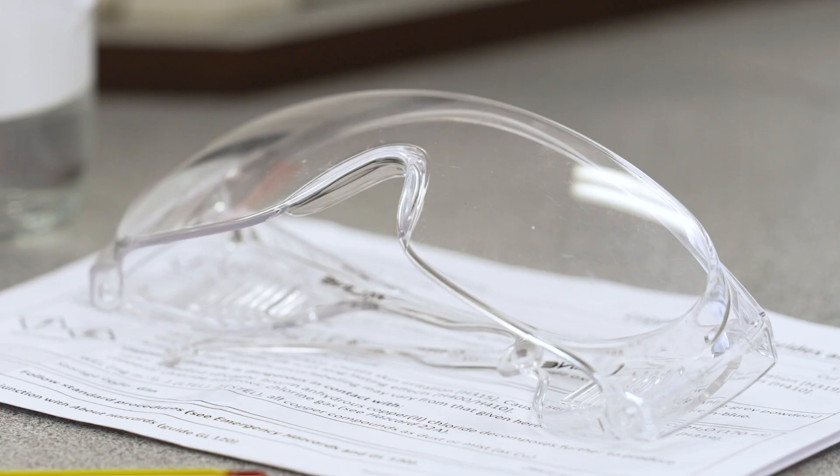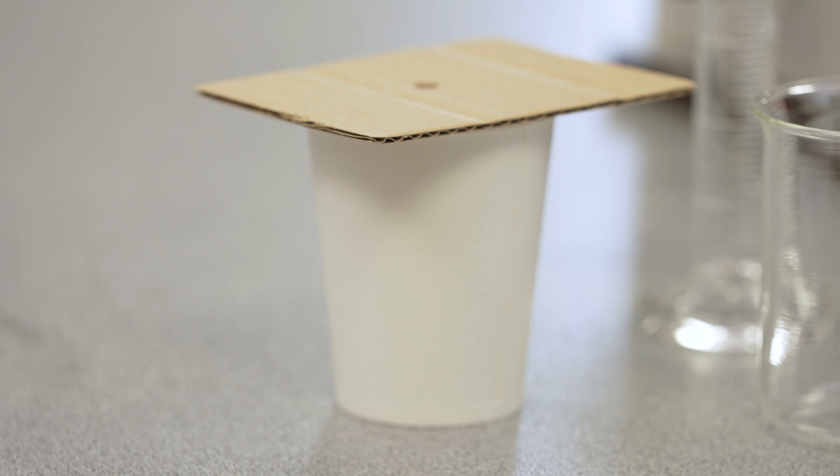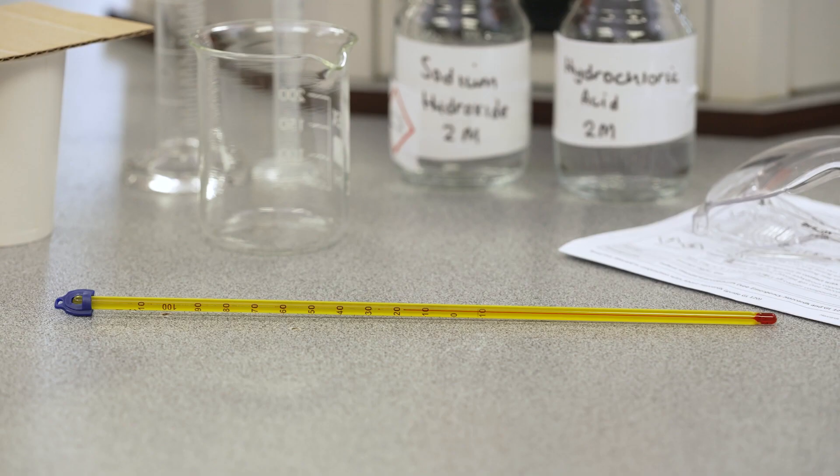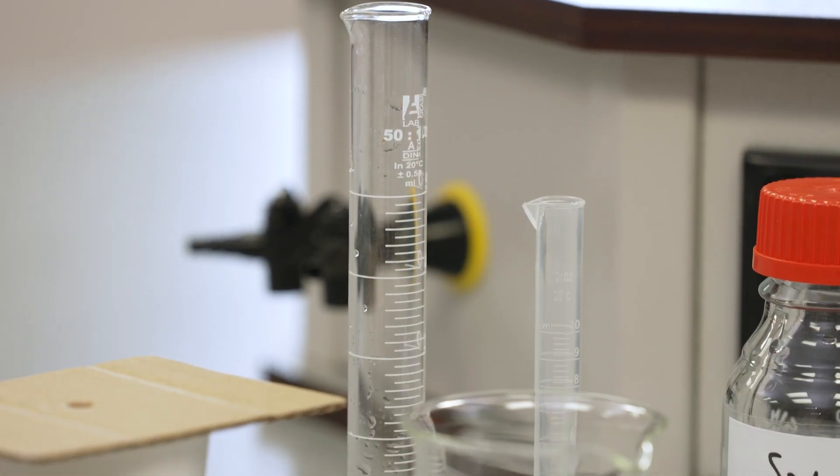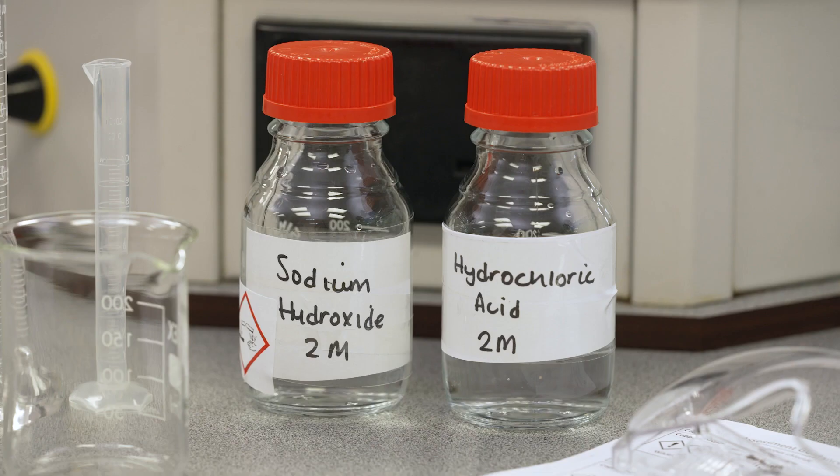For this experiment we'll be using the following equipment: safety goggles and the appropriate CLEAPSS hazard cards, insulated cups with a lid, a glass beaker, thermometers, measuring cylinders, hydrochloric acid and sodium hydroxide.